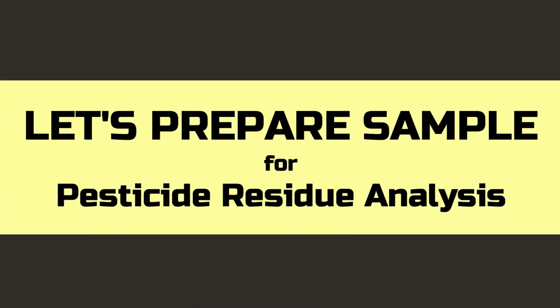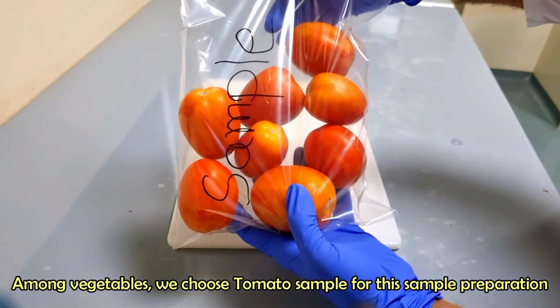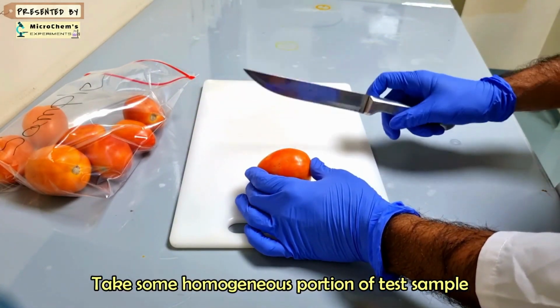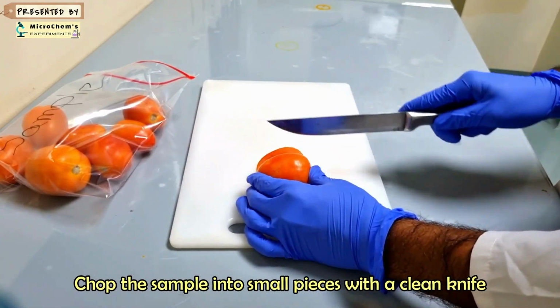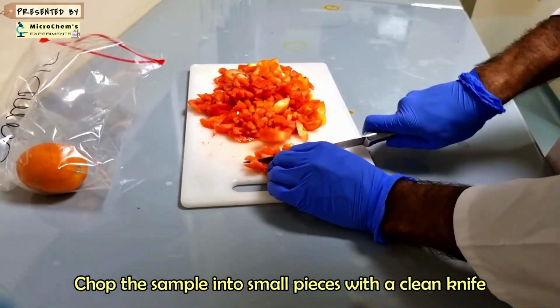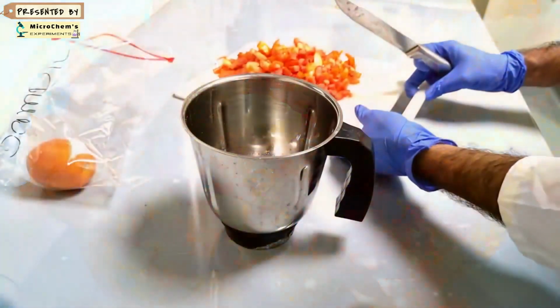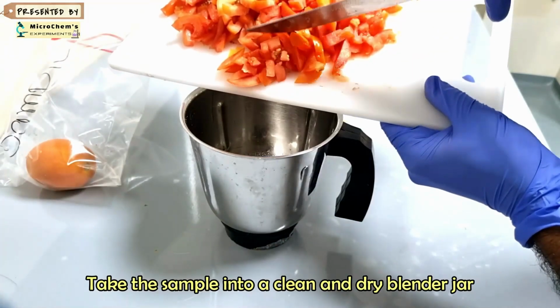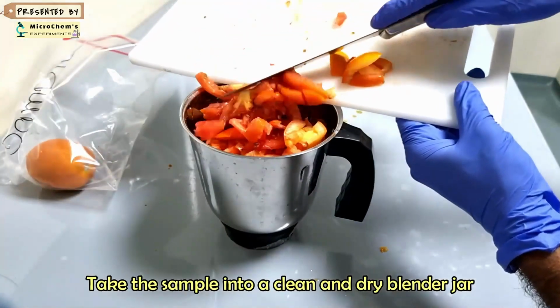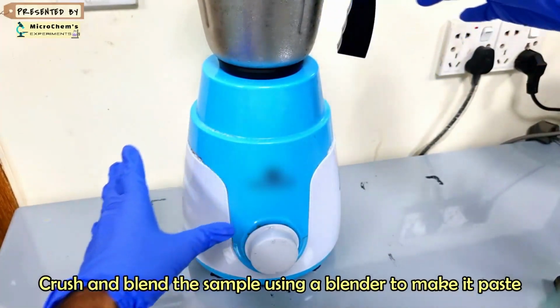Let's prepare a sample for pesticide residue analysis. Among vegetables, we choose a tomato sample for preparation. Take some homogeneous portion of the test sample and chop it into small pieces with a clean knife. Crush and blend the sample using a blender to make a paste.